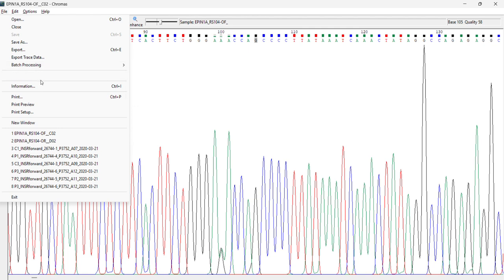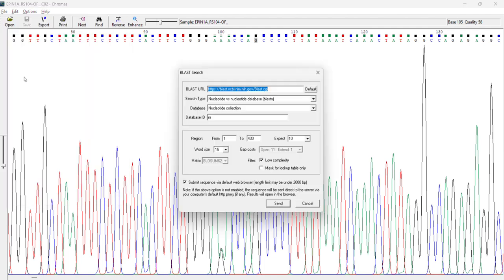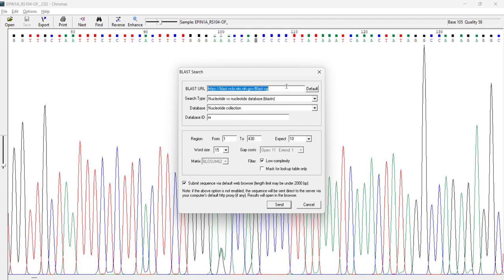The next is the BLAST search, right? These are some of my last opened data sets. So if I do the BLAST search, I click here, and all these settings I will not be changing. BLAST versus nucleotide, everything will be the same. Region I can select from 1 to 430, and it will automatically read. But if I want to change, for example, I just want till 400, I'll type 400.